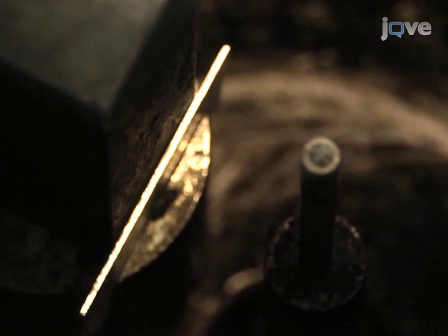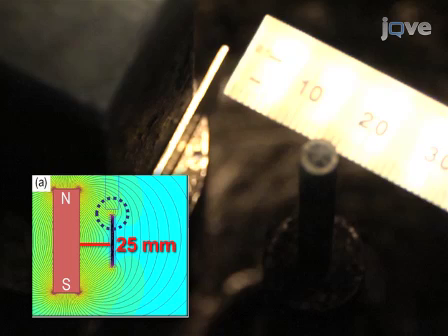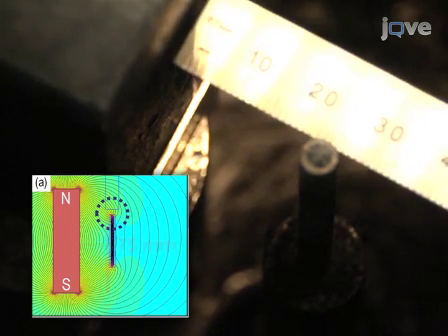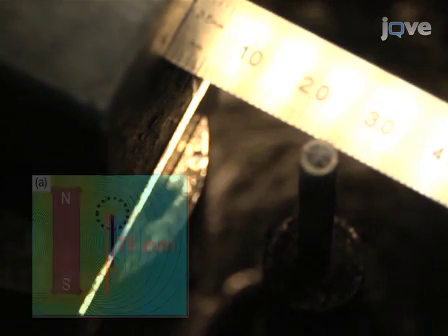To set up the substrate, place a cuboid permanent magnet inside the chamber about 25 mm away from the inter-electrode axis. In this configuration, the inter-electrode gap is set at a distance of about 75 mm from the bottom of the permanent magnet.